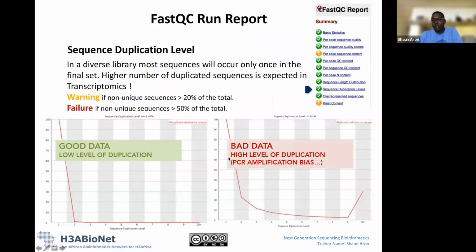So this is an example of bad looking data where you see that we do have some percentage of 2 copies duplicated. So over 20% of our data set has 2 copies of a particular fragment. It goes down, and then you'll see again here, towards the end, almost 30% of our data set has fragments where there's 10 copies of duplicates. So this is exact duplicate sequences.